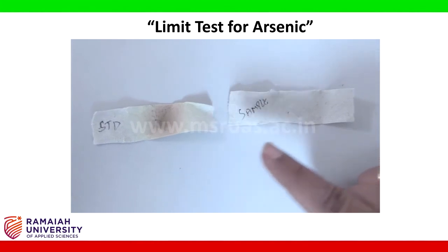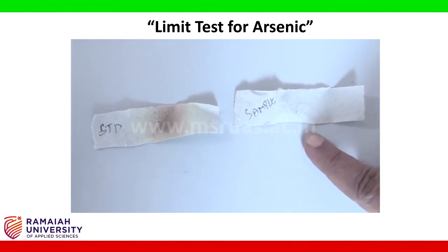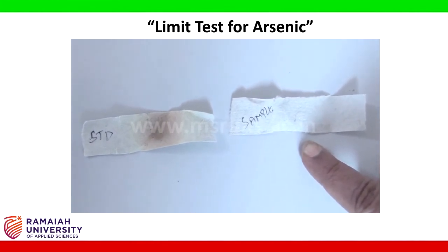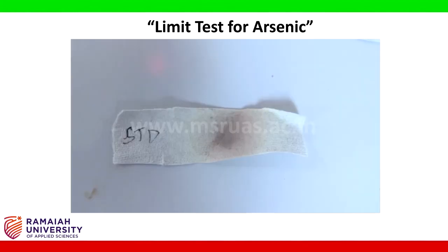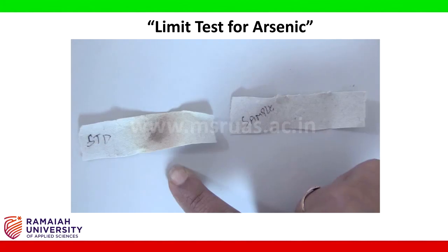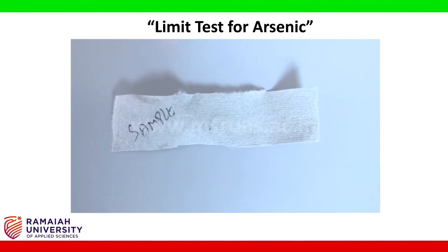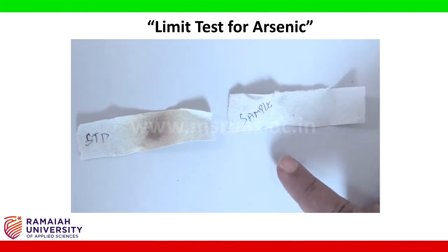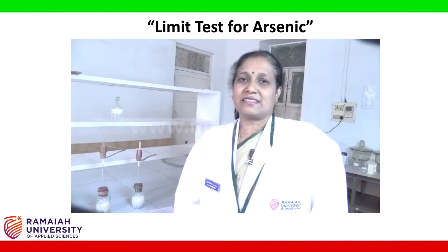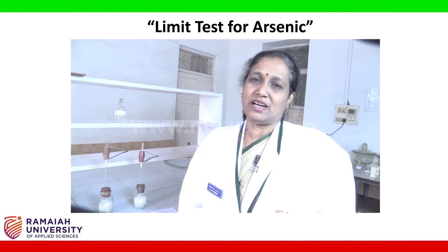Now, how to report whether the given sample passes the limit test for arsenic or not? We will compare the standard stain with the sample stain. The standard stain is more intense compared to the sample stain. Hence, the given sample passes the limit test for arsenic. This completes the limit test for arsenic.